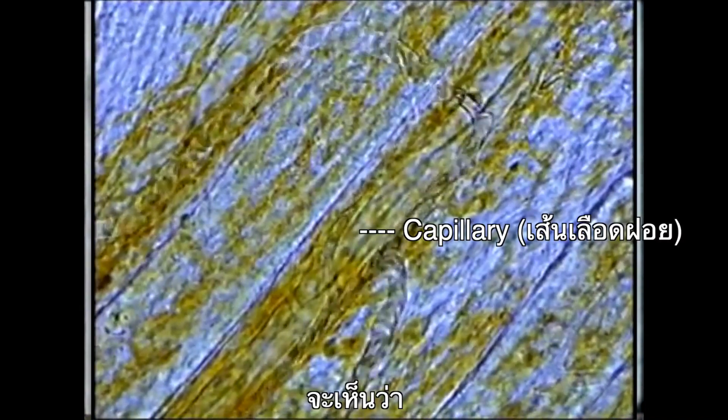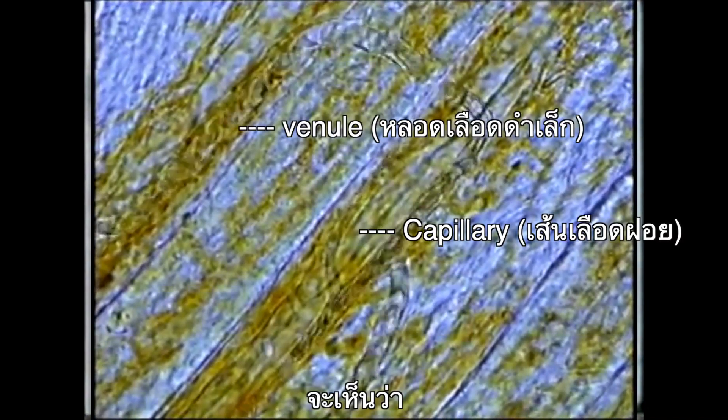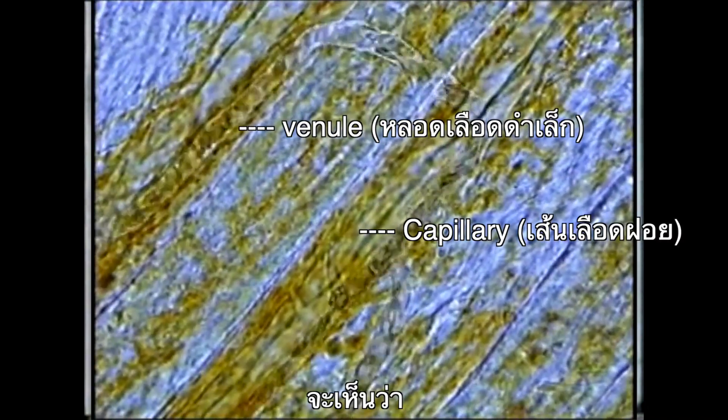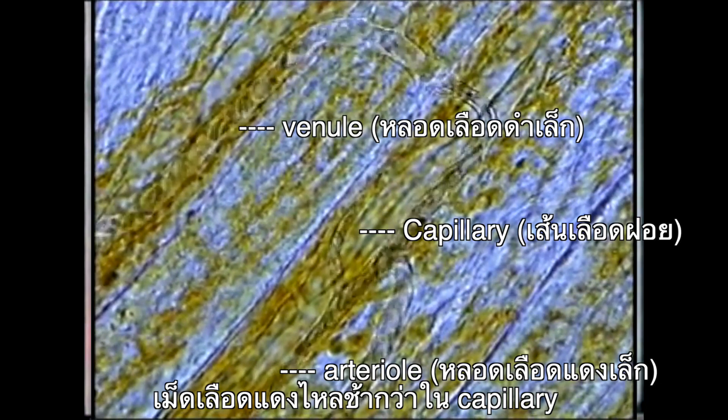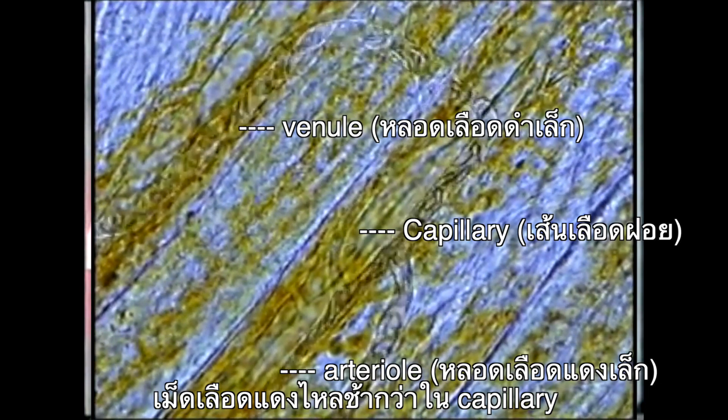You should be able to see red blood cells slowly moving through the capillary.